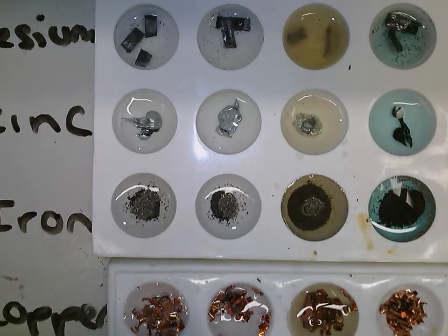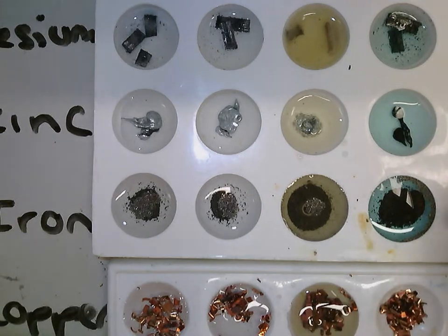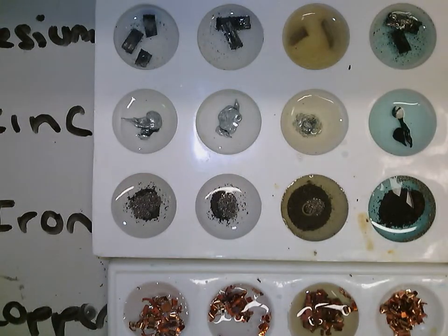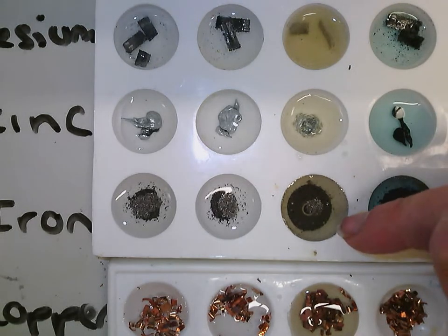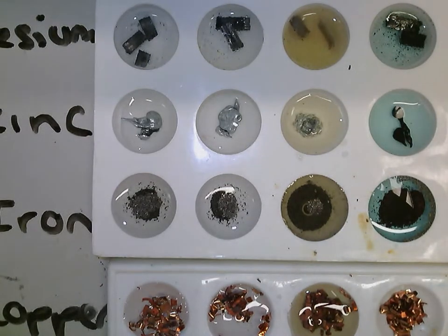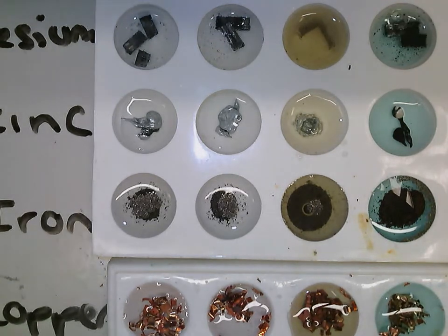It's actually changing colour, so it's going from this silver colour to copper coloured, and this is because copper metal is forming. So as the copper sulfate reacts, the iron takes its place, forming iron sulfate, which is a green liquid. So if we leave this for long enough, it'll turn sort of the same colour as this one. And you can see copper metal is on the top there. Reacting copper with copper, you can see nothing's happening there, as copper shouldn't react with itself.